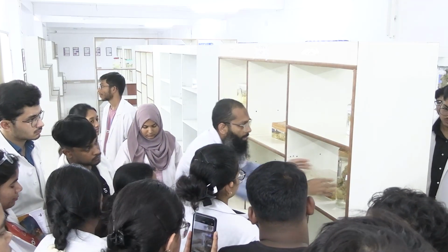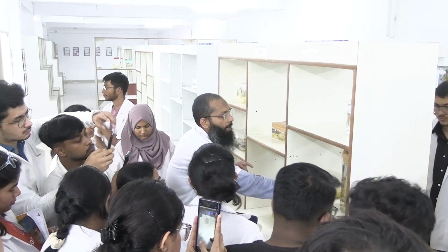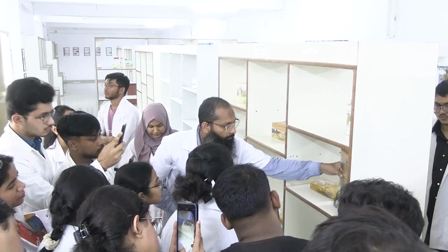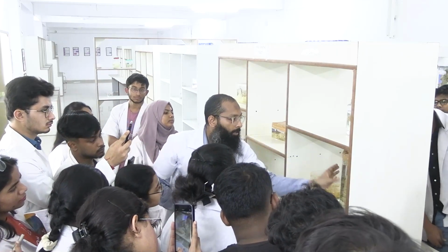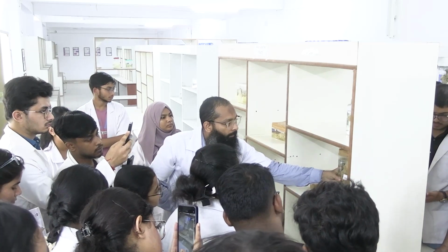So there is a skin layer present over here, okay, skin layer, and this is the nipple-areola complex, fine. This is the nipple-areola complex. So these are the points under which you have to describe, okay.